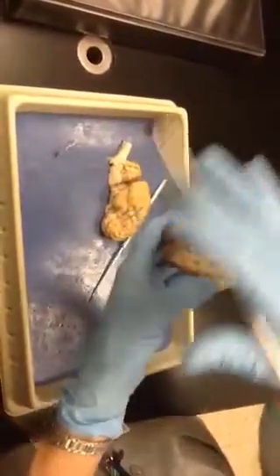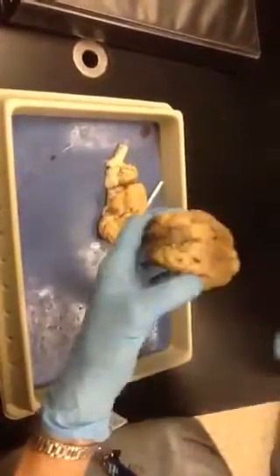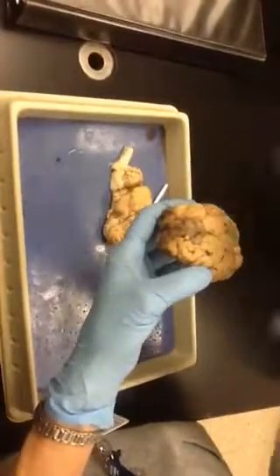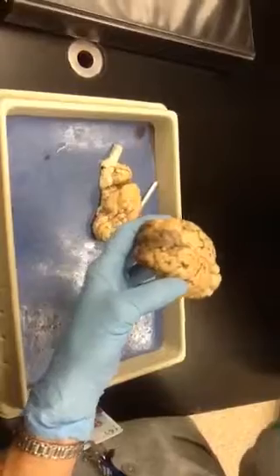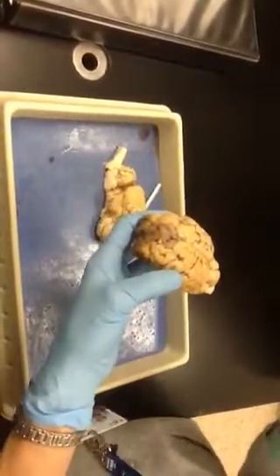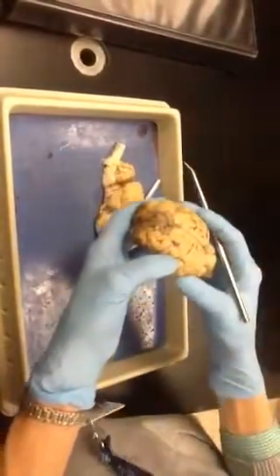Okay. On top of that is the arachnoid mater. Arachnoid, like a spider web. It's a thin membrane. And then on top of that, the outermost membrane is called the dura mater. It's a really thick, white, tough membrane, and that holds your brain up to your skull.